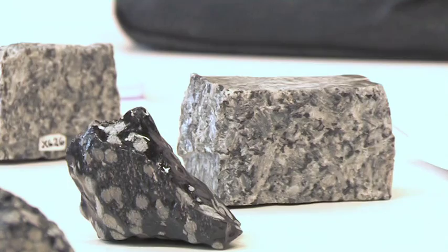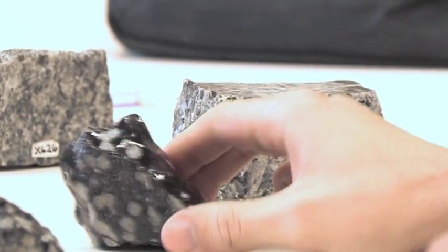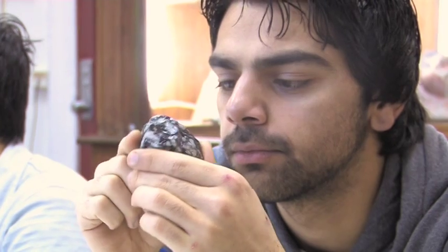Especially for geology, it's really important that students see the actual specimens. You can talk through things theoretically and discuss concepts like texture, but until they've actually seen it in a rock it doesn't really mean very much. In geology we talk about getting your eye in, which means learning how to take what you've learnt theoretically and apply it.